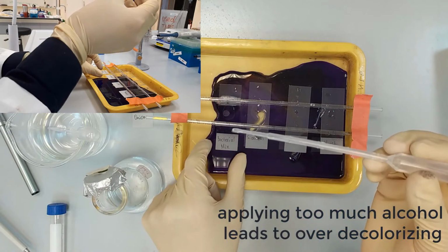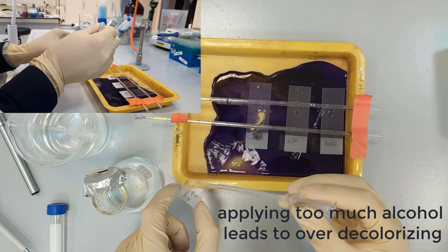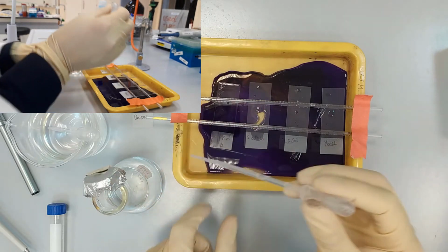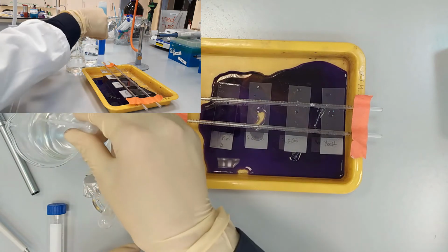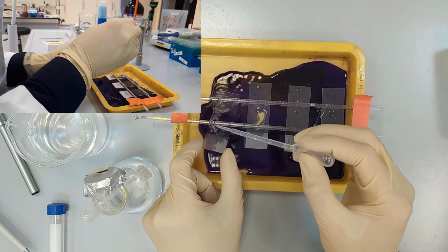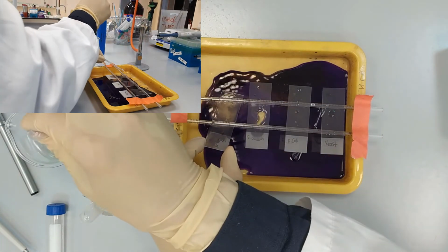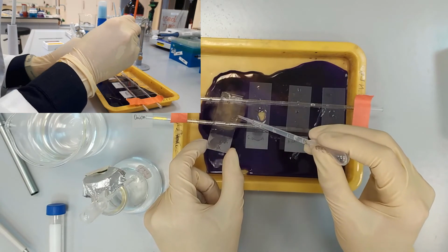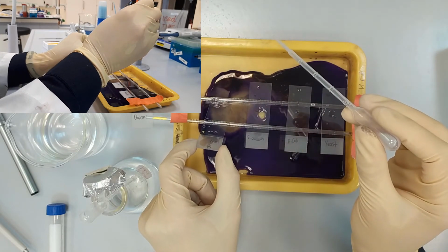So don't overdo that. And wash it with the water. So we wash the alcohol with water so it does not over decolorize our samples.